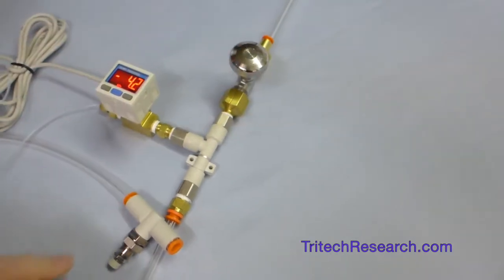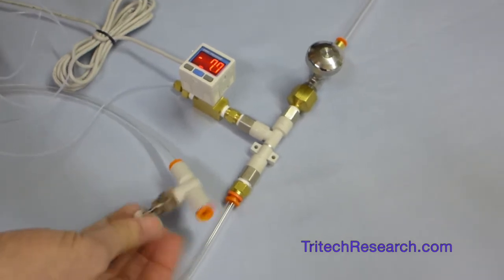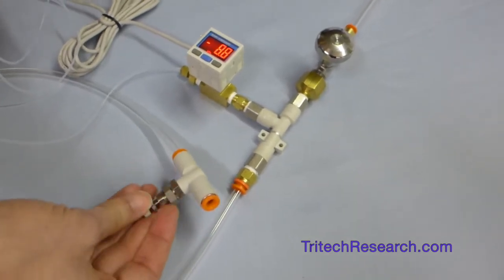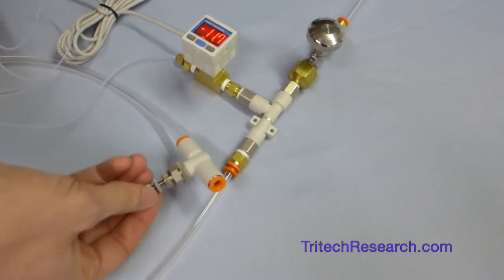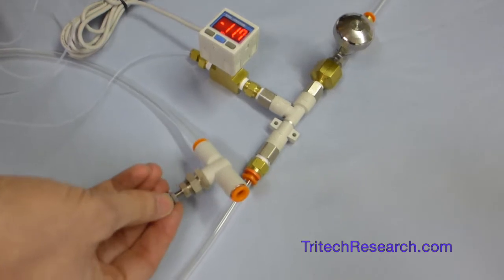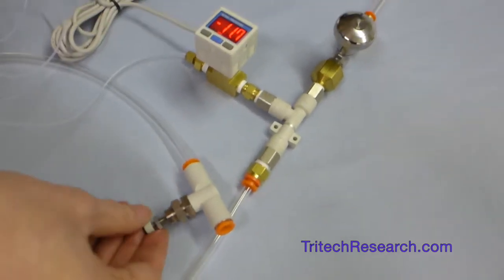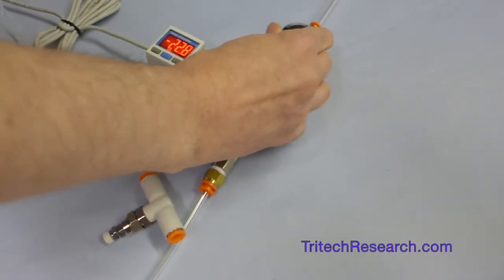We can just have less flow. And then we won't be able to get to as strong of a negative pressure as we were before, but we can still do something. At this setting here, we can only go to about minus 2 psi or something like that.